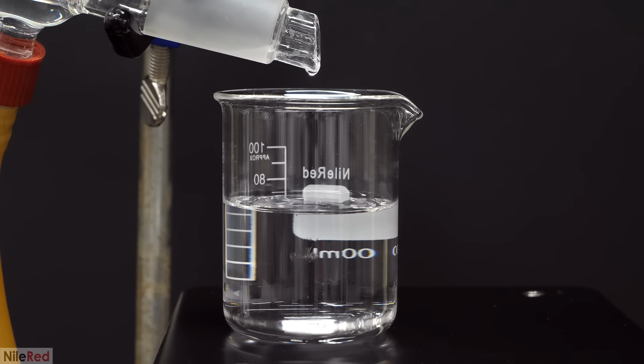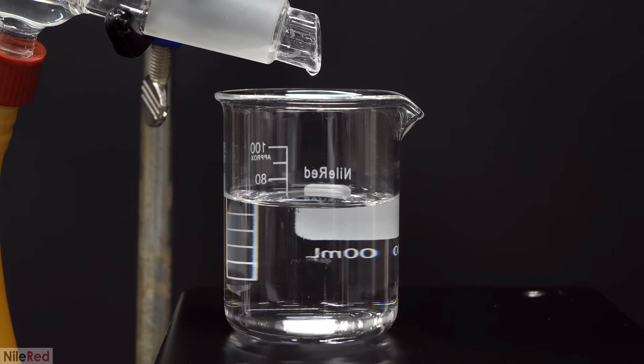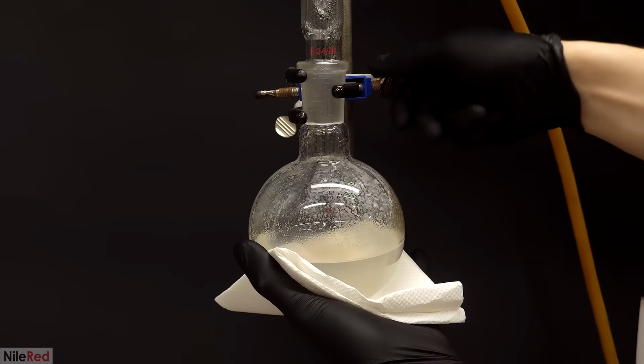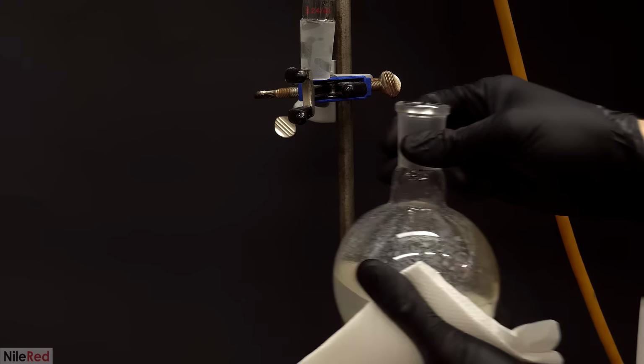Also, like I said before, I was starting with a relatively pure sugar source, so there weren't that many side products that could be made. When it got to around 80 mils, the temperature was about 99 C, and I didn't taste ethanol anymore, so I considered it done. This was everything that was left in the boiling flask, and like all the other runs, I waited for it to cool, and then I got rid of it.